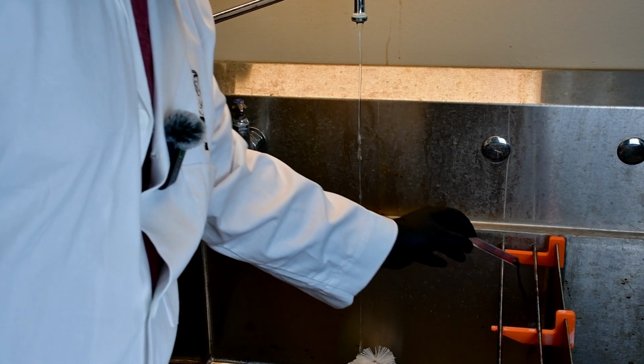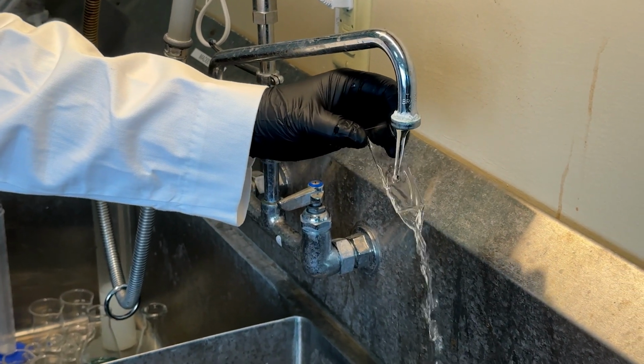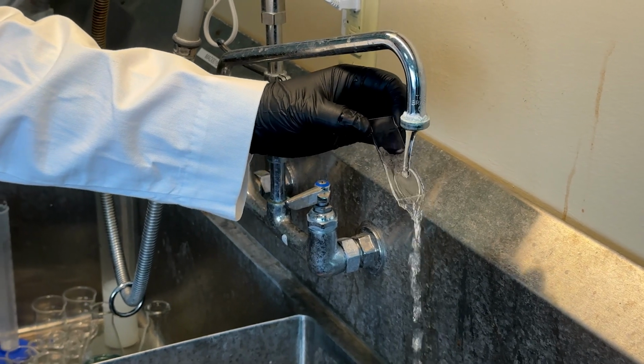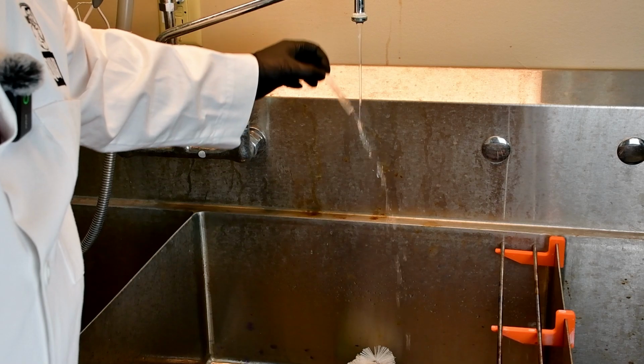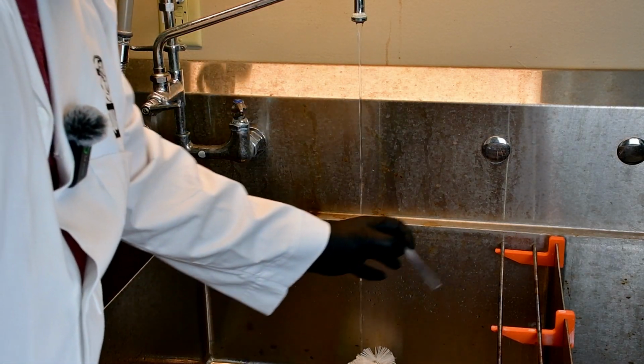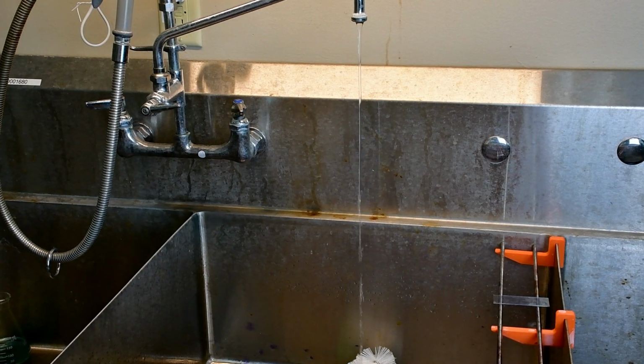I'm going to rinse off my slide, same way, keeping it near the top. There's more than one way to kind of do this. I like to hold the slide long ways and let the water run down the slide. Place it here. Now this next step is a little bit trickier. This is the decolorizing step. Now, you need to be a little bit careful here.